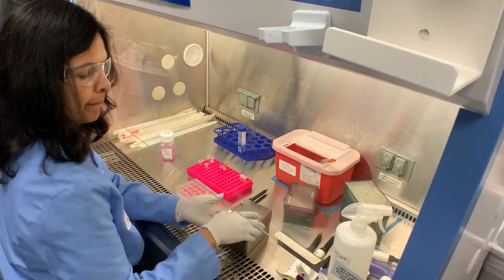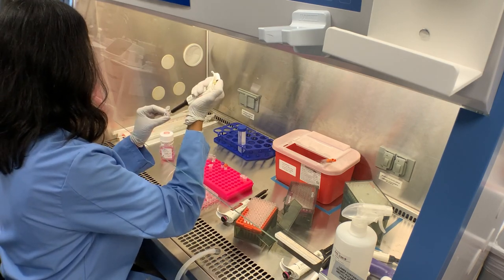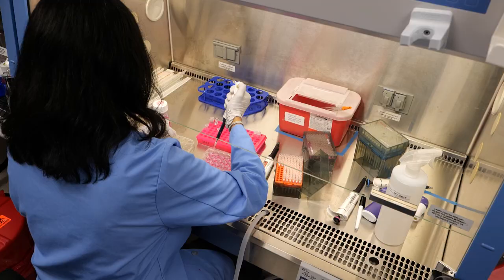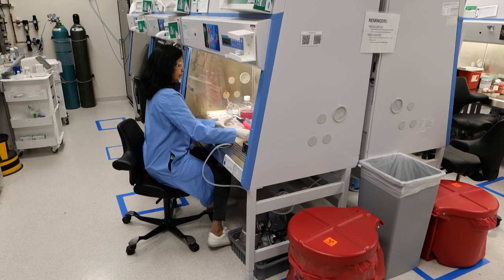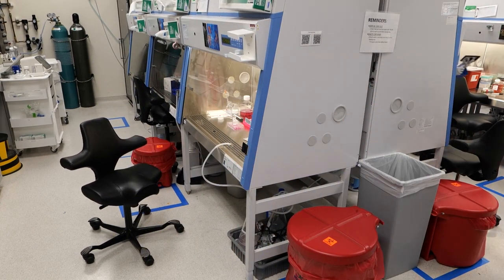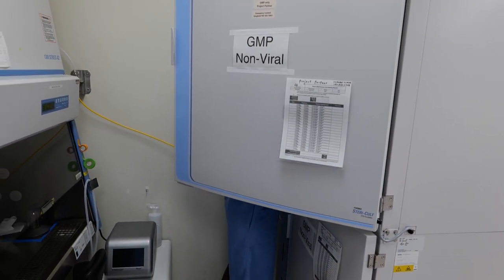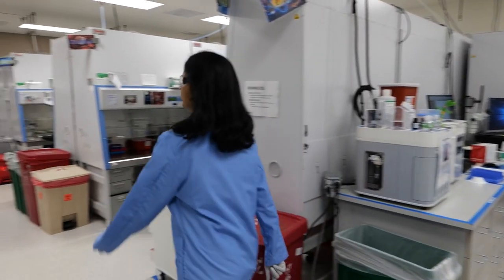We recommend mixing Cas9 protein and gRNA at a 1-to-1 ratio, and make sure to add the Cas9 Plus reagent to the tube last. Set these tubes aside at room temperature while you prepare a second corresponding tube for each gRNA. For the second tubes, dilute the CRISPR Max reagent in Opti-MEM and incubate at room temperature for 1 minute and no more than 5 minutes. Then mix tubes 1 and 2 for each corresponding gRNA and incubate for 10 to 15 minutes at room temperature. While transfection reagents are incubating, you can optionally refresh the media on your cells to the final volume suggested in the TrueCut Cas9 protein user guide. For our 24-well plate, the volume of media will be 0.5 mL.